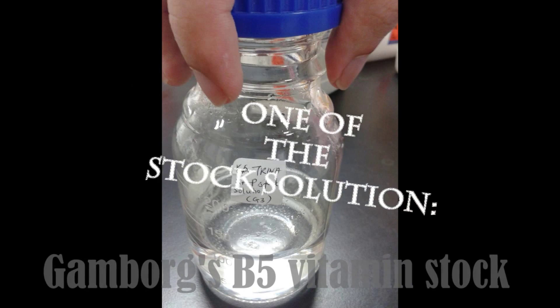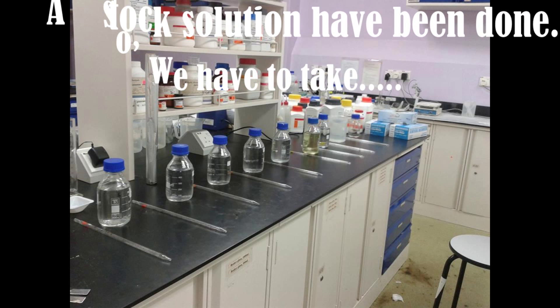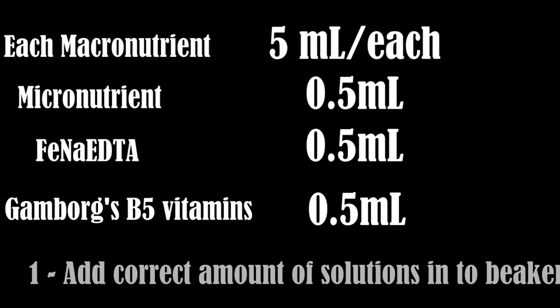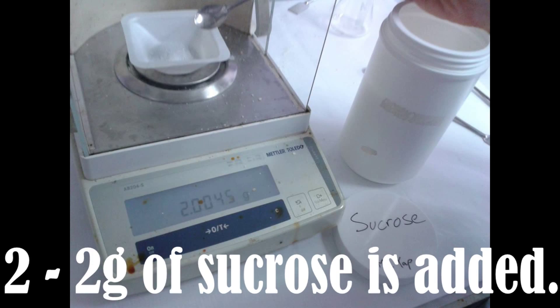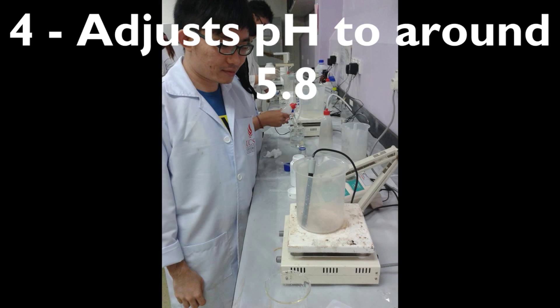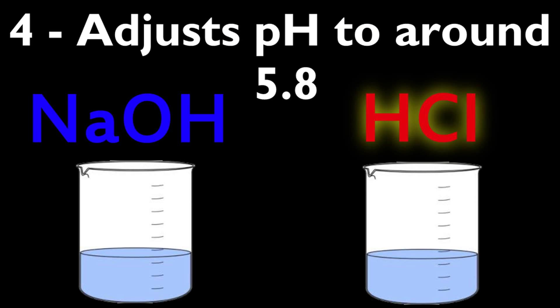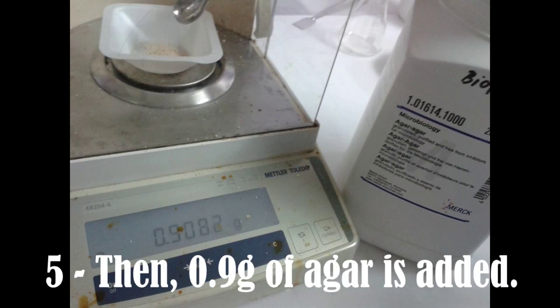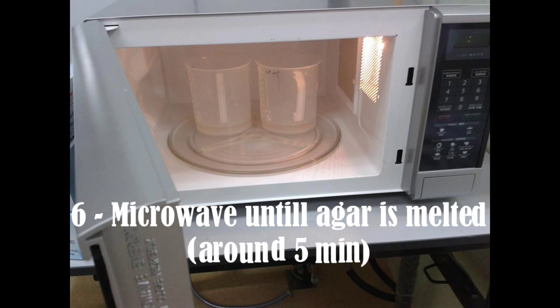This is one of the stock solutions. Now, all stock solutions have been prepared, so we take the correct amount of each solution into the beaker. Add 2 grams of sucrose and dissolve it completely. Adjust the pH to 5.8 by adding sodium hydroxide or hydrochloric acid, then bring up the volume to 100 milliliters. Add 0.9 grams of agar and microwave it until the agar is melted.